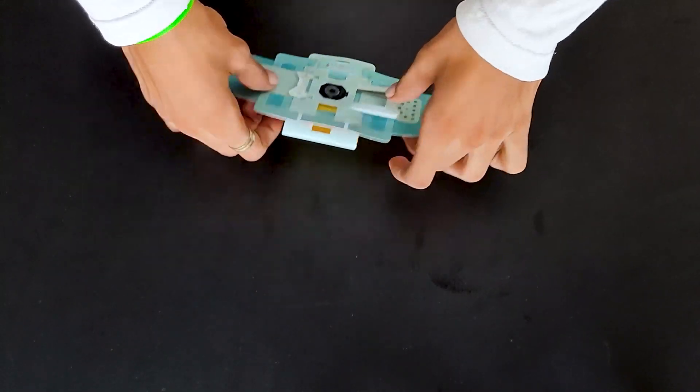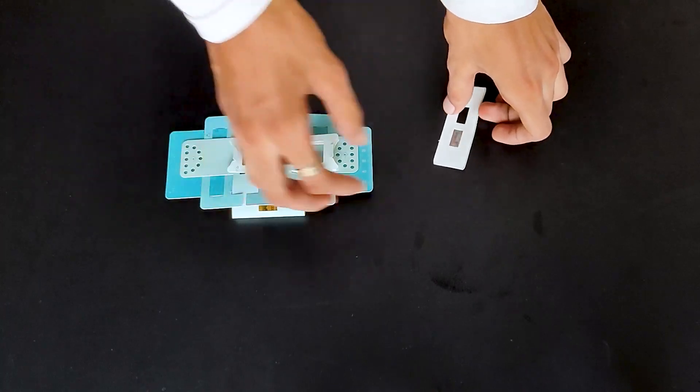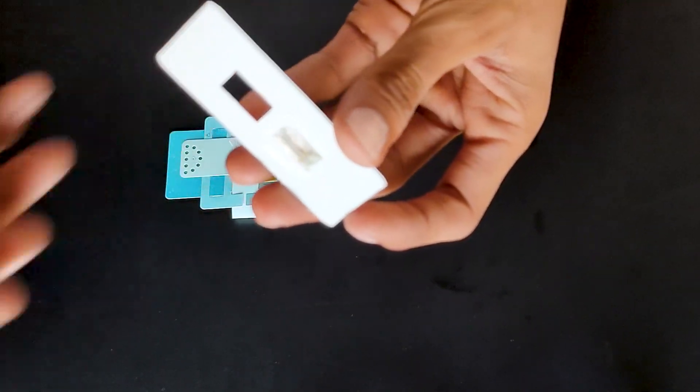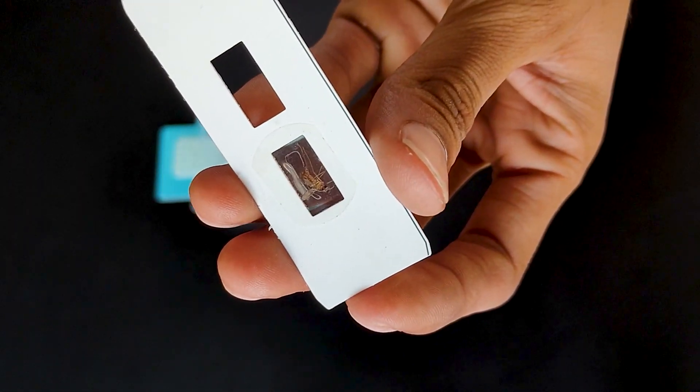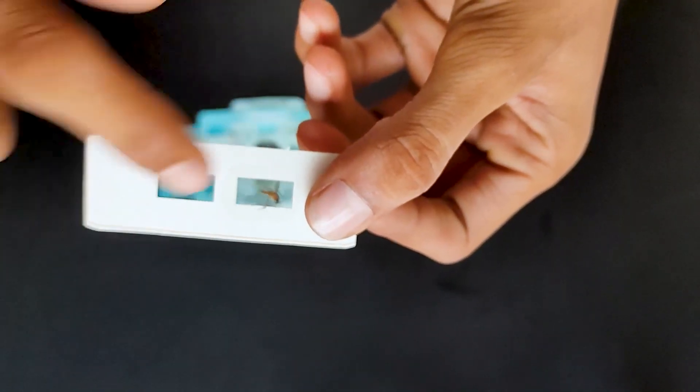So guys, here is the fold scope which we have already seen in a video, and here is that slide. I have already killed this mosquito, sorry for that. I have already made this slide.